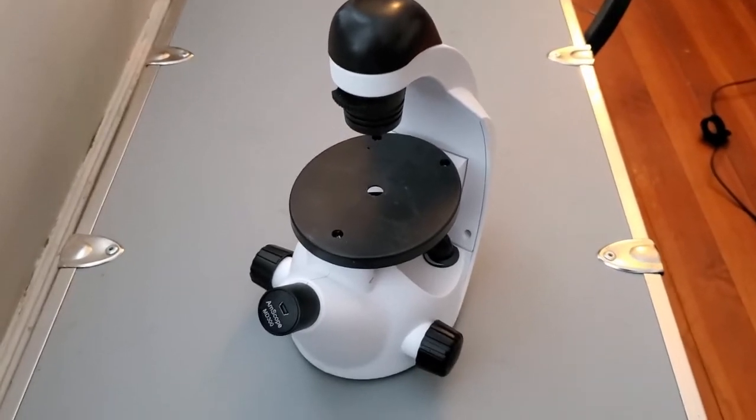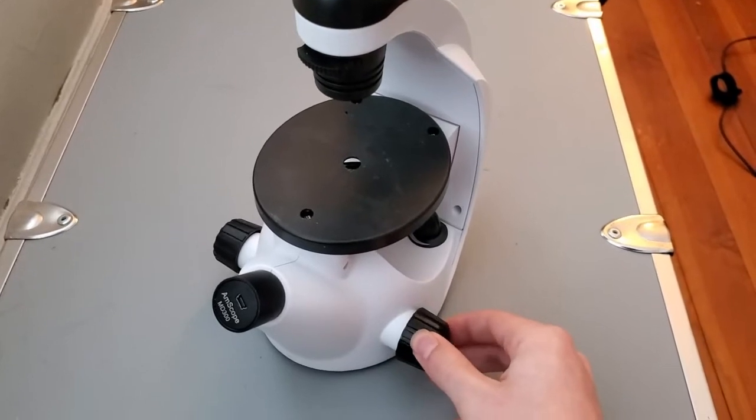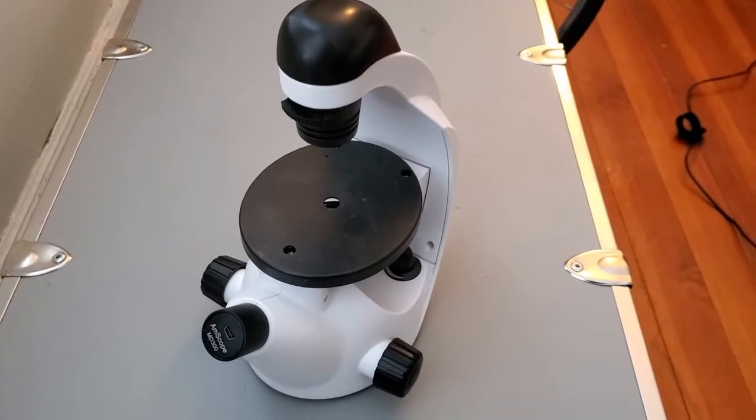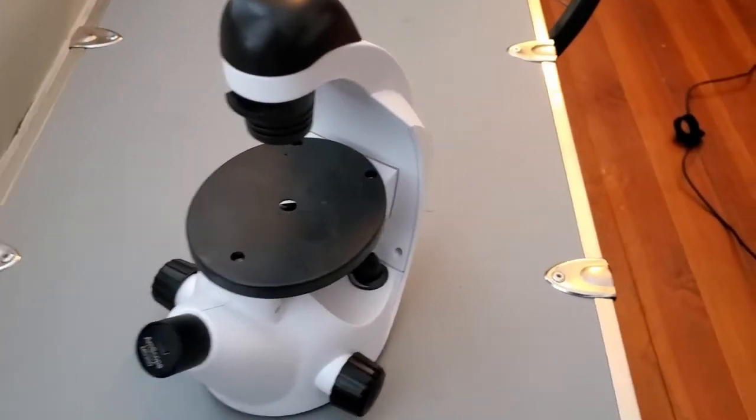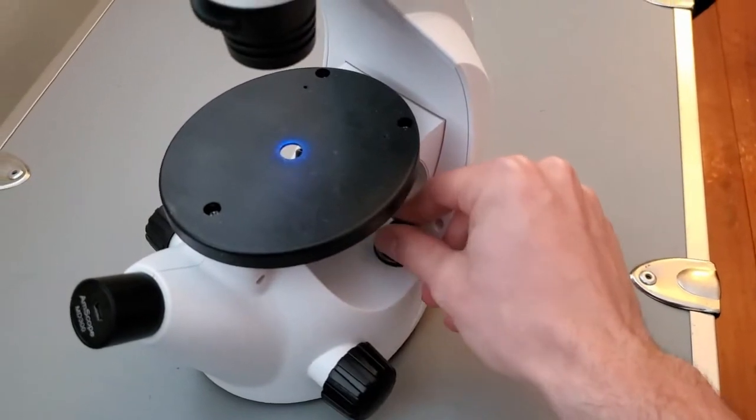You've got the dial controls which adjust your focus. There's no fine adjust on this microscope, pretty much just coarse adjust, but it does the job. Also got your light to illuminate your samples underneath.